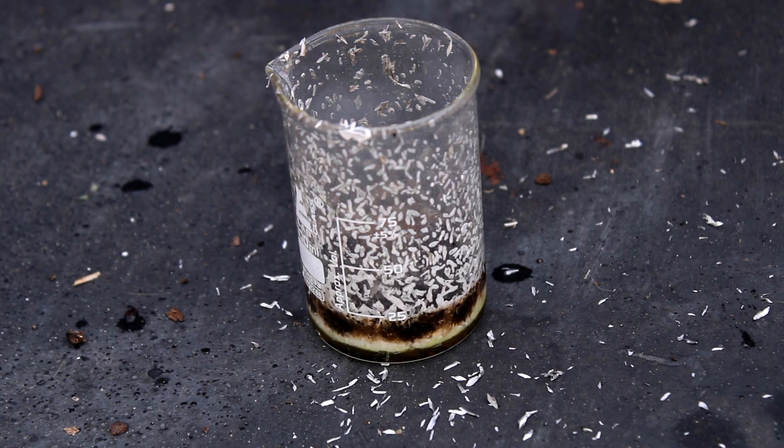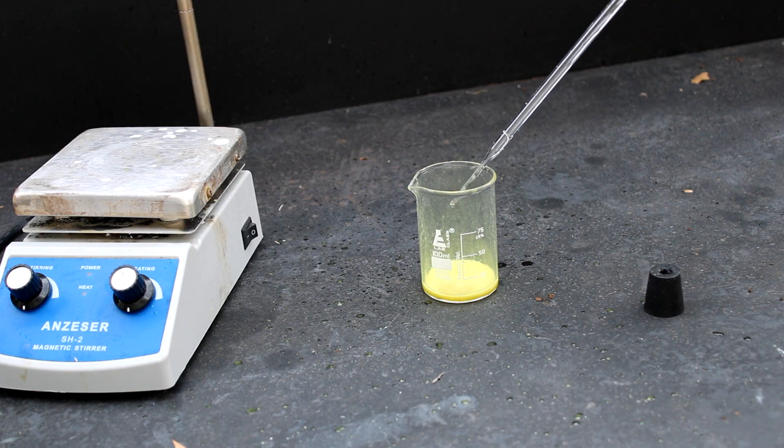Anyways, there you have it, chloric acid and chlorine dioxide from matches. I hope you enjoyed this little excursion into the world of useless and mildly unstable chemistry.